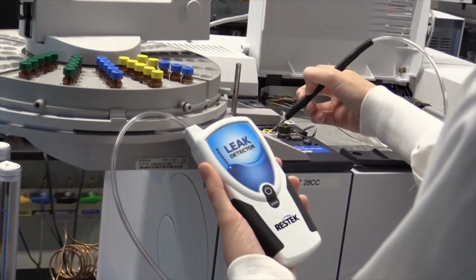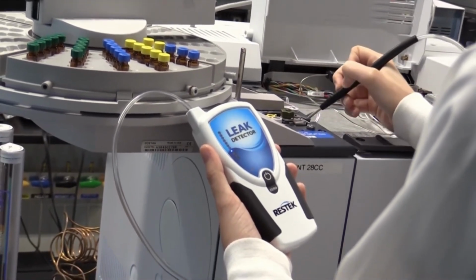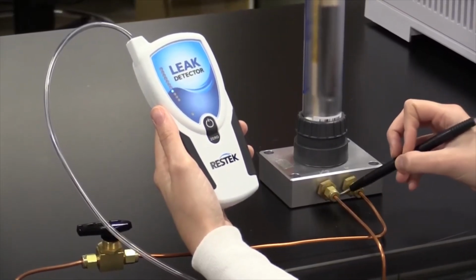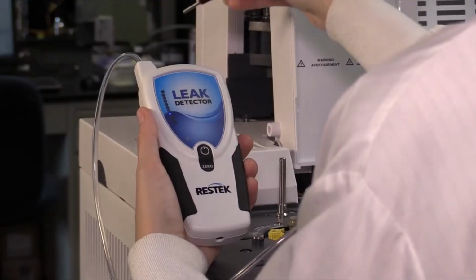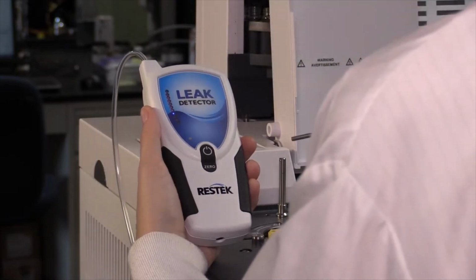The Restek Electronic Leak Detector is an essential tool for troubleshooting and routine maintenance of your gas chromatograph. It should be used daily to ensure that your instrument and gas delivery systems are in top working condition. Full instructions are available at www.restek.com/leak-detector. But here is a quick overview of some best practices for leak checking and maintenance.